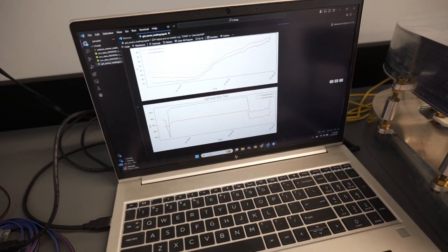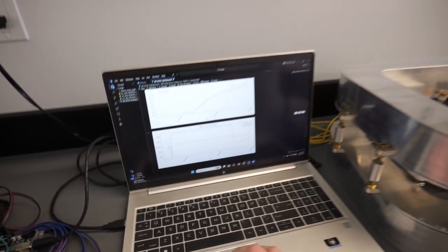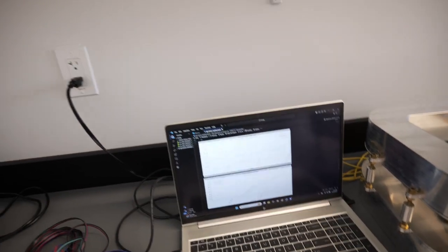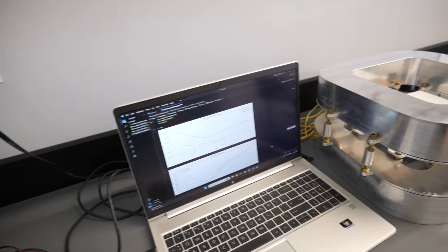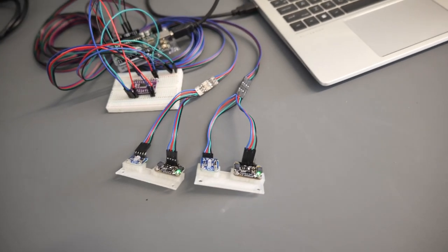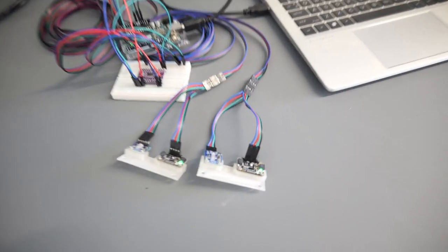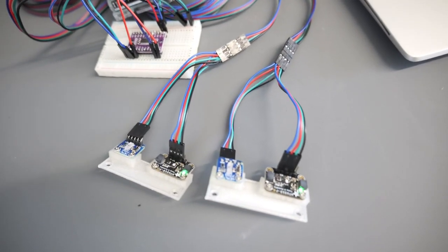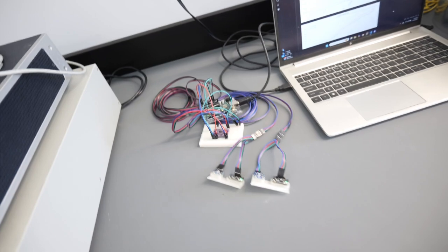We get the blue and the sort of orange curve there for the two different environments, and there's a slight difference, which is very, very tiny in temperature and humidity, which, I mean, could be real or could be just due to the sensors being slightly different and wired with different wires and so on.